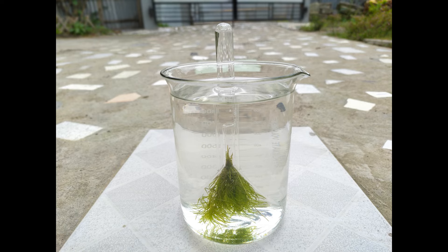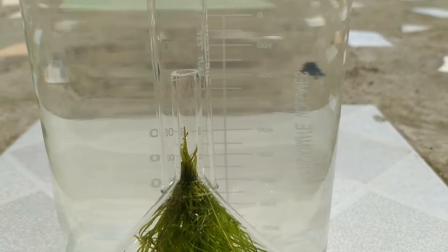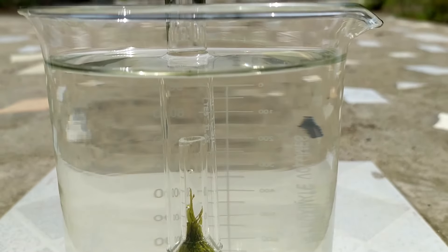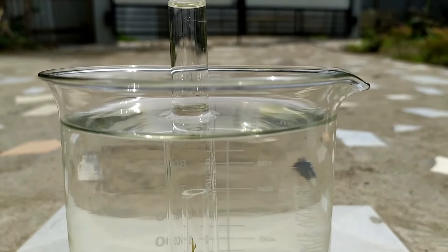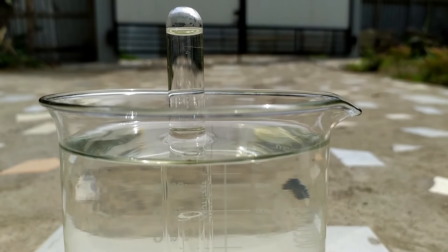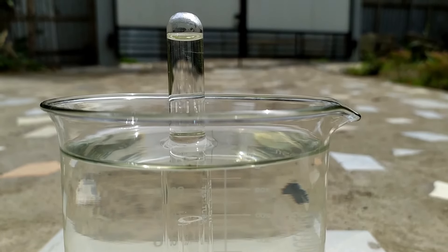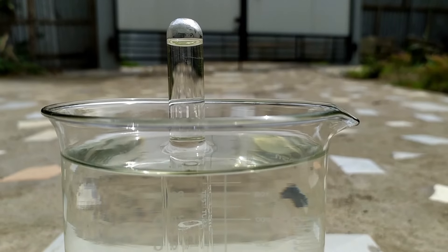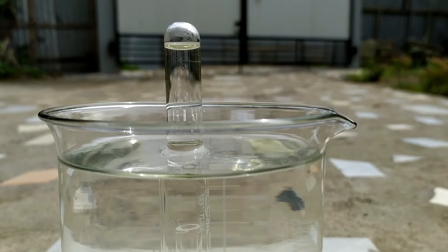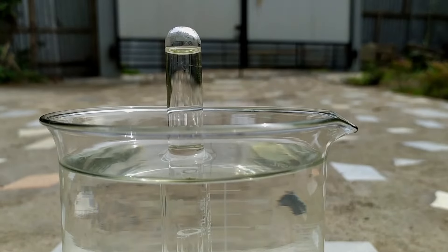A few minutes after exposure to sunlight, you'll notice tiny air bubbles evolving from the cut ends of the stem of the aquatic plant. These air bubbles travel up through the tube of the funnel and eventually collect in the upper end of the test tube. As time passes, more air bubbles collect in the test tube. Leave the setup in sunlight until the test tube is completely filled with the gas.